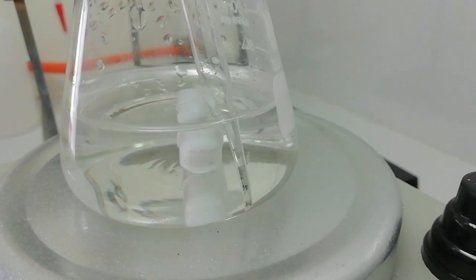Right now you can see the reaction with the sulfur dioxide gas. Sulfur dioxide gas is in contact with sodium carbonate. You can see very tiny bubbles of carbon dioxide gas being produced. When the carbon dioxide bubbles stop producing, we know the reaction is completed. So I am going to continue bubbling sulfur dioxide gas until no more carbon dioxide bubbles are produced.